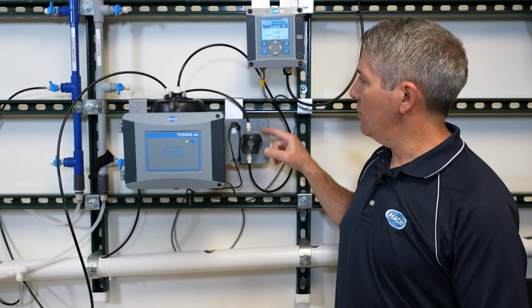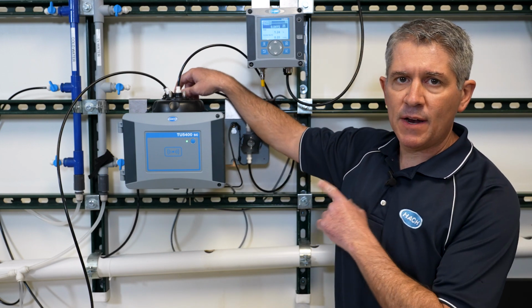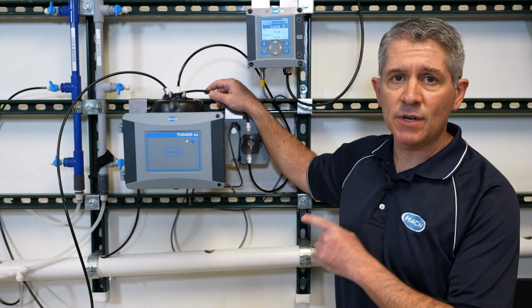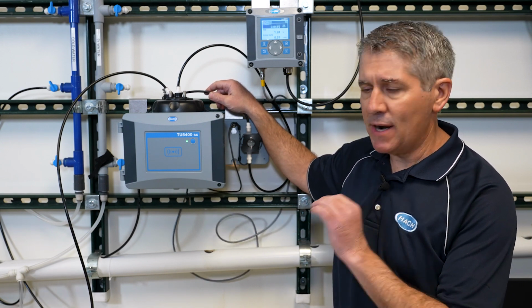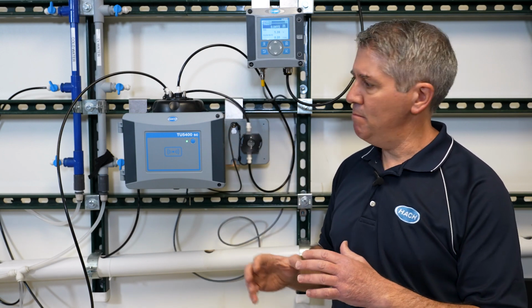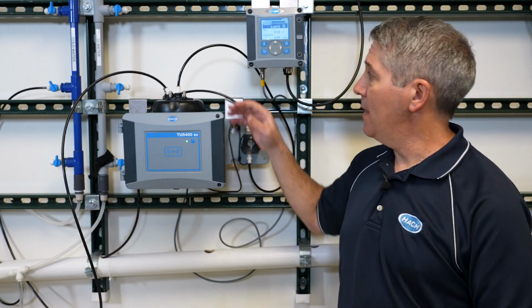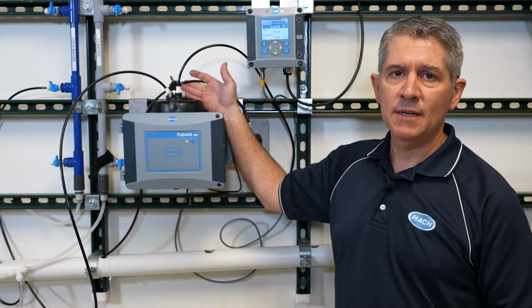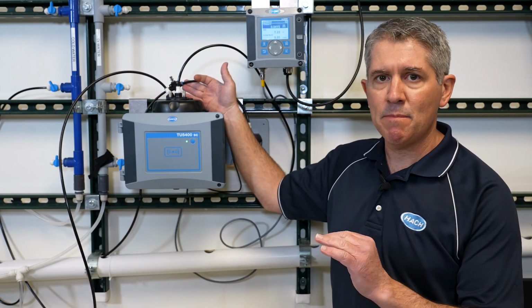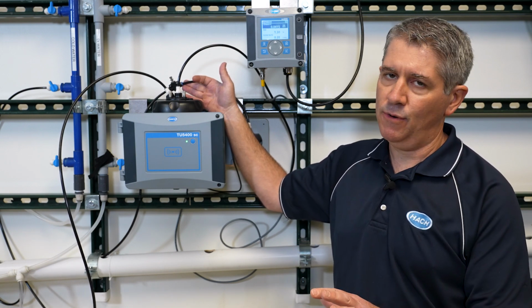So once it goes through the flow regulator, it goes to the back pressure valve right here. It's very important that these both are on the downstream side. The flow regulator, rather, to minimize any sort of turbulence that's on the sample line going in. The back pressure valve right here, this is essential to minimize the bubbles. If this isn't on the downstream side, it's not going to do anything for you.